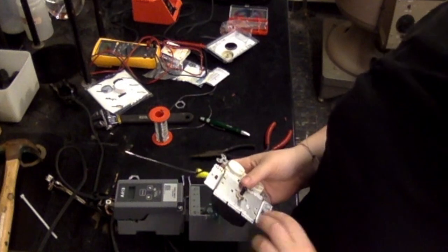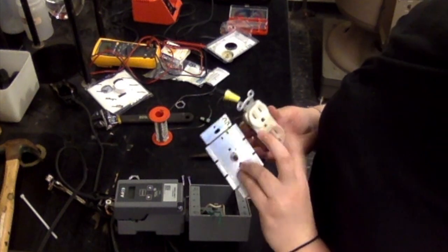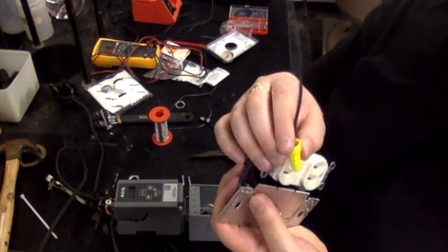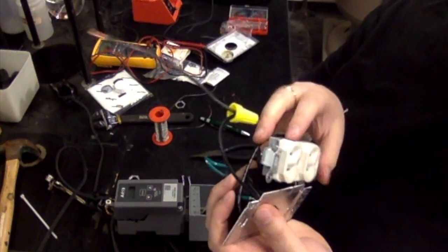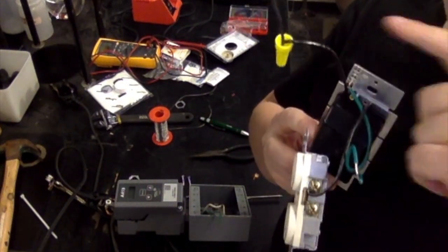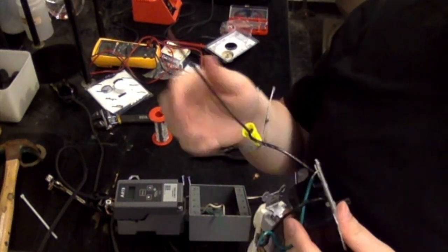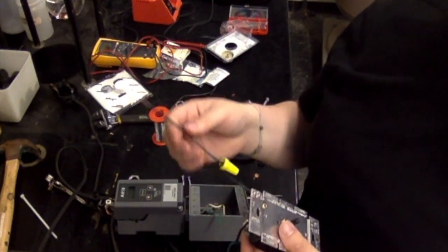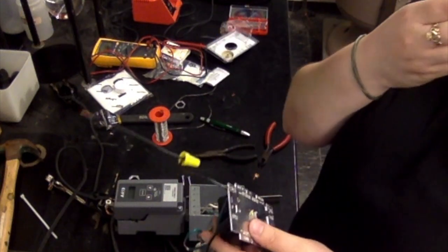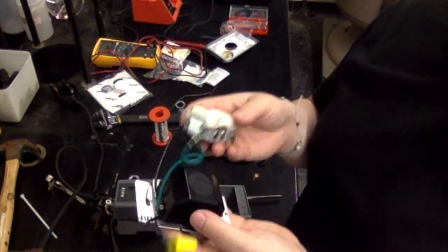Okay, so the next connection that we need to make is from the A419 to the dimmer switch, and then from the dimmer switch to the 2-gang outlet. The first thing you'll want to do is put an extension on one of the black wires. It doesn't matter which one from the dimmer switch. So you'll have the 2 black wires and the green one here. Pick one of the black wires, put an extension on it with a screw nut, and this is going to feed into the A419 up into port 6. Again, make sure you have enough length there. Once that piece is on, you can go ahead and connect the 2-gang outlet to the dimmer switch.